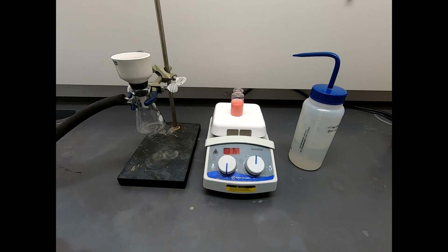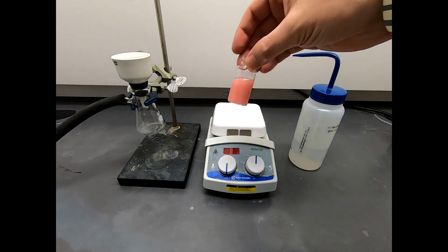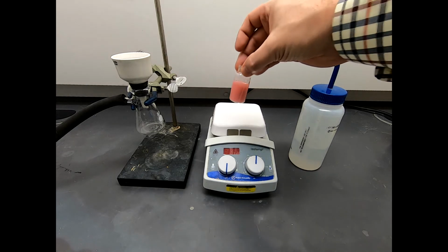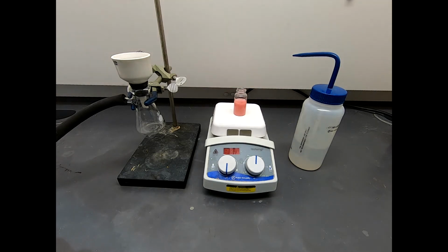Alright, everything is cooled down nicely. If you notice, it's kind of interesting, this reaction mixture has gone from looking kind of orange to almost a little bit pink. So that's kind of unexpected. I wouldn't put too much stock into these color changes, but it's important to observe them. If you were to run this reaction and it didn't turn that same shade of pink, I wouldn't worry about it. But still, organic chemistry is full of colorless liquids and white solids, so it's always fun to see a little bit of color.